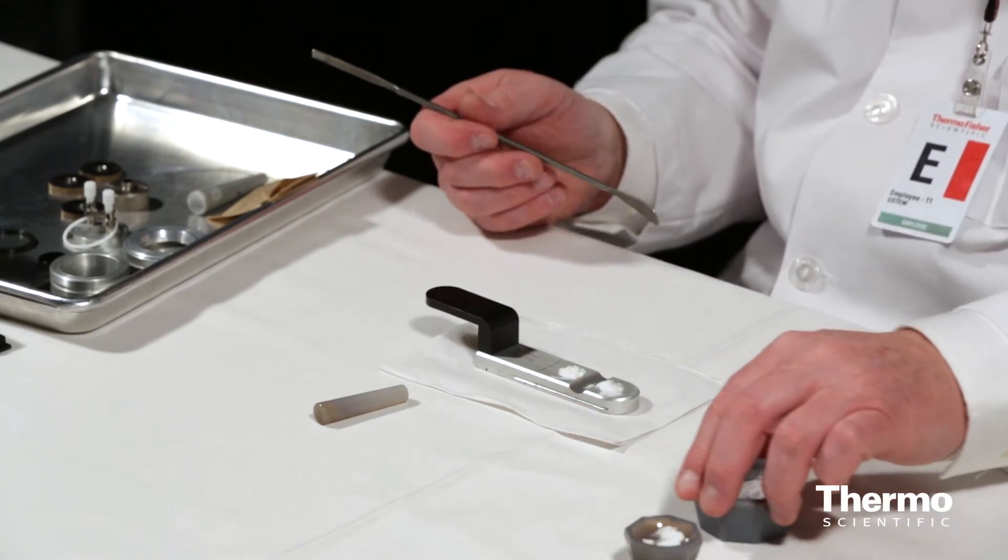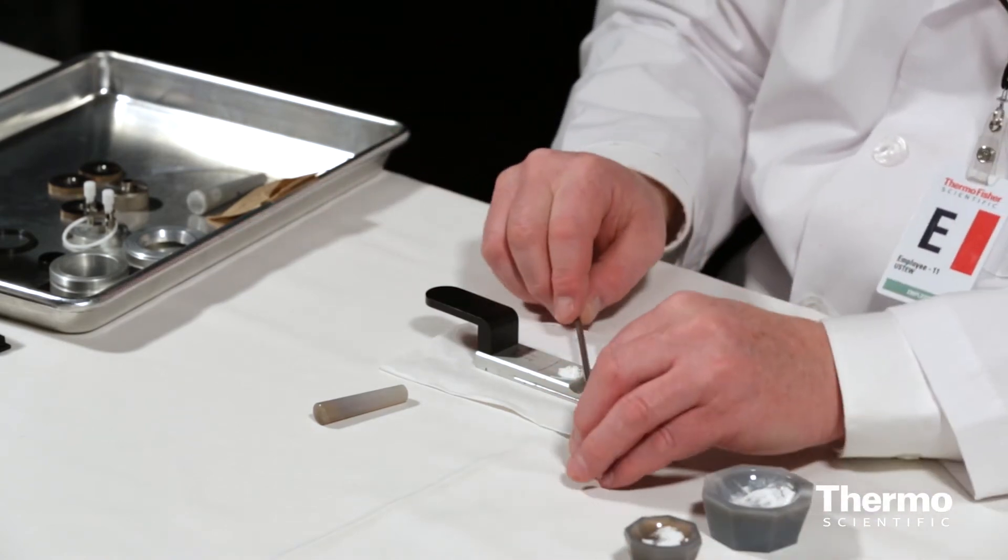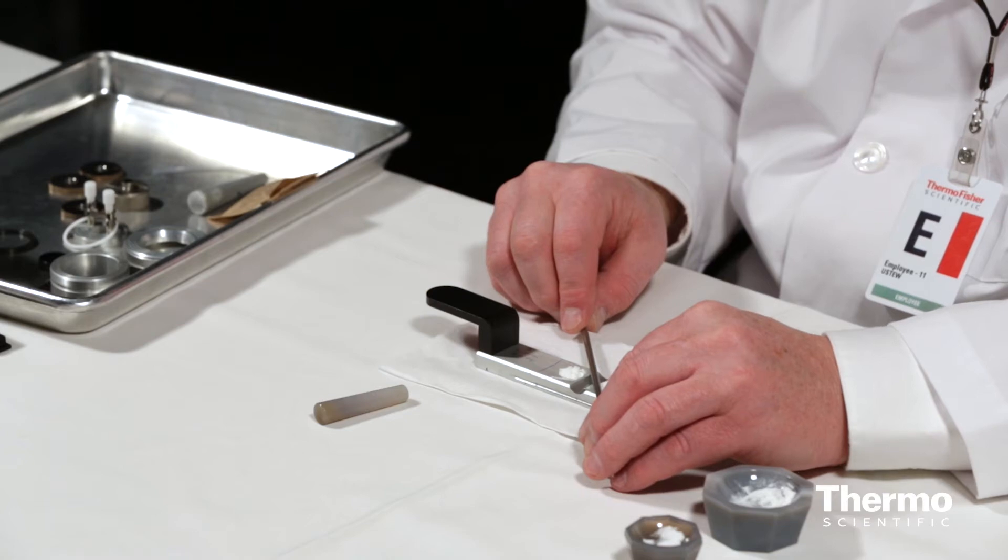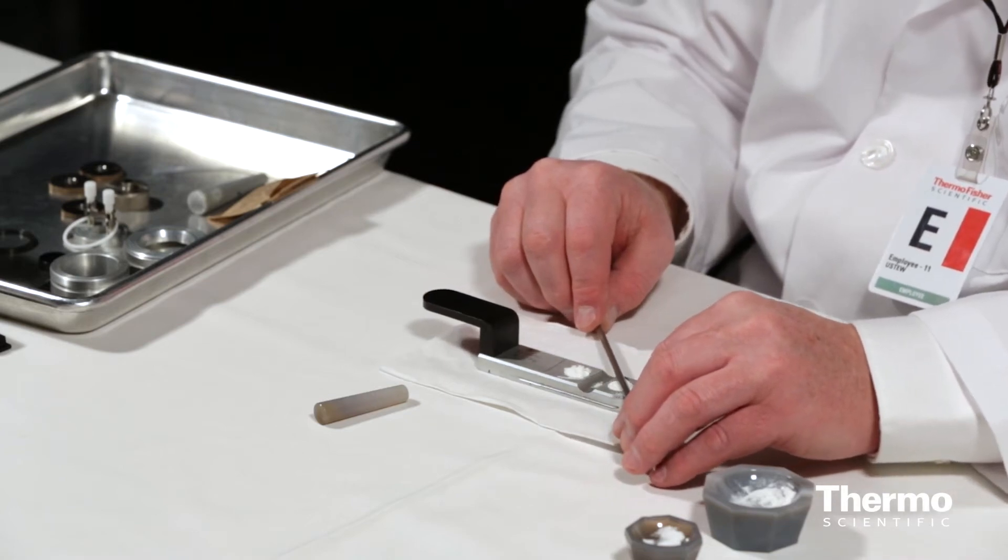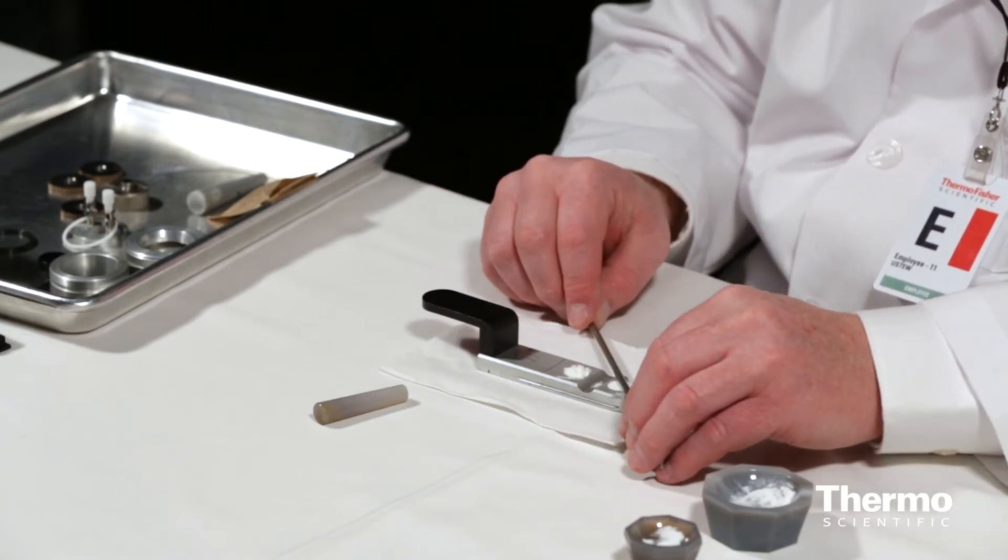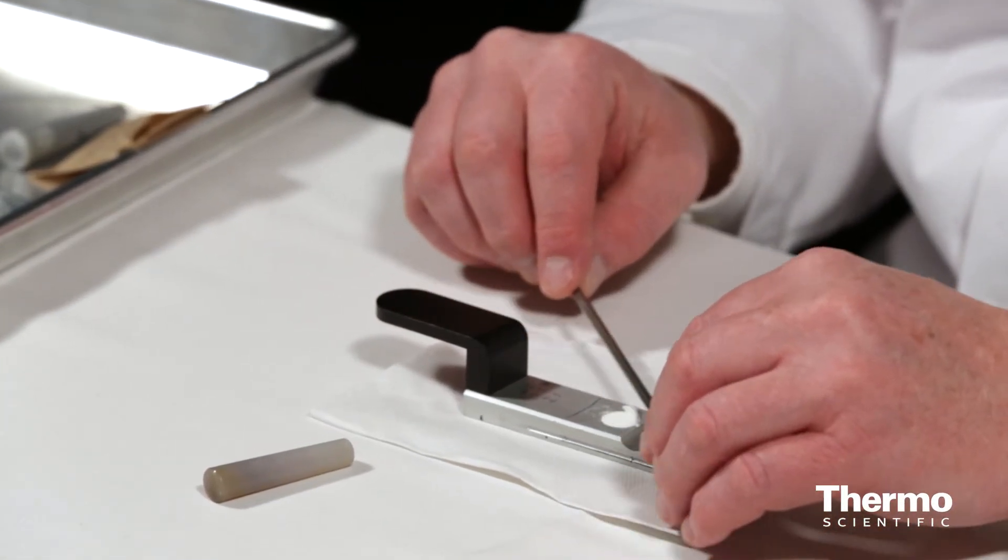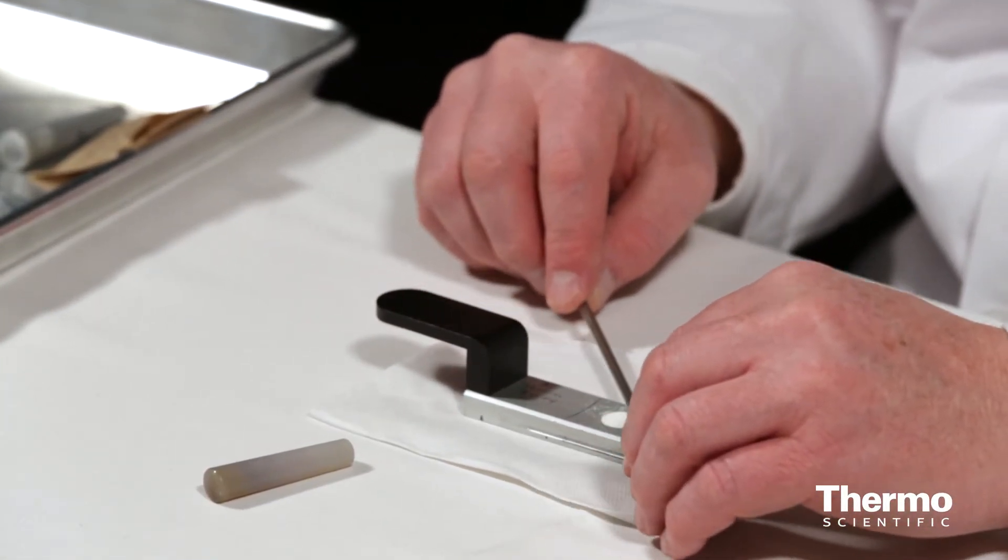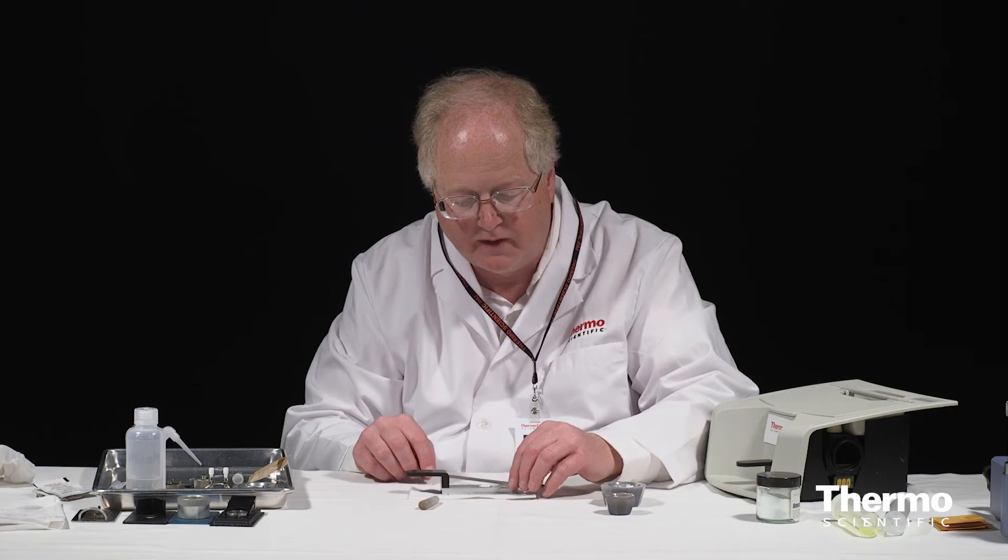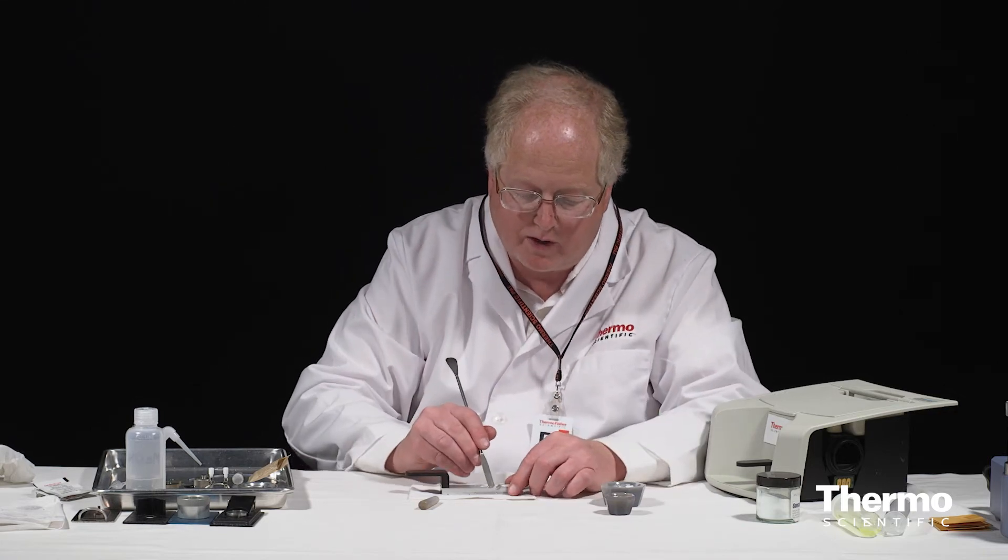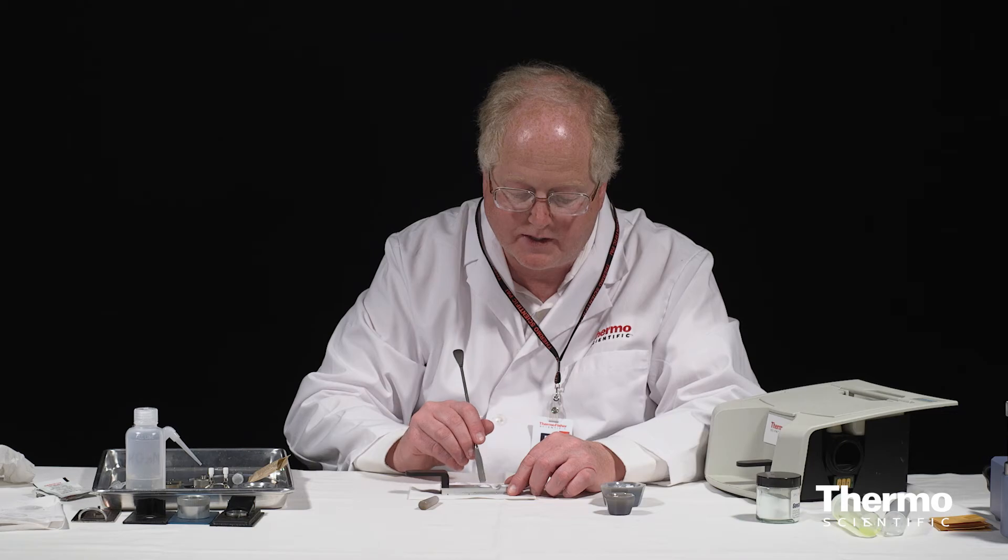Okay, doesn't matter if I spill right now because my last step in my preparation is going to be to level the surface. So I'm just going to take my tool here and drag it along the surface. Do the same back here, dragging it all on the surface, make sure it's filled in.